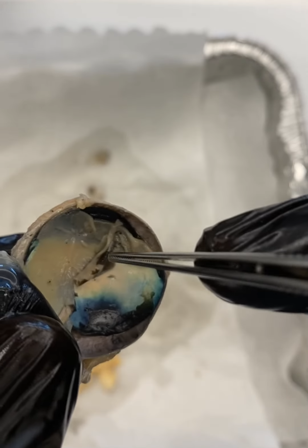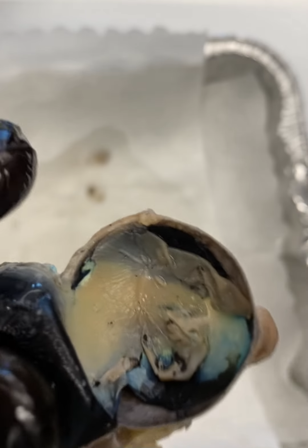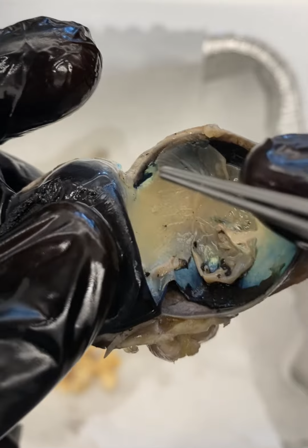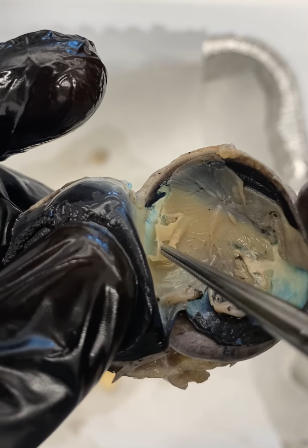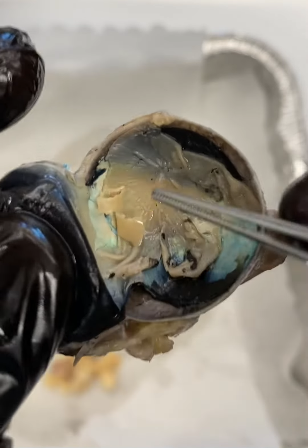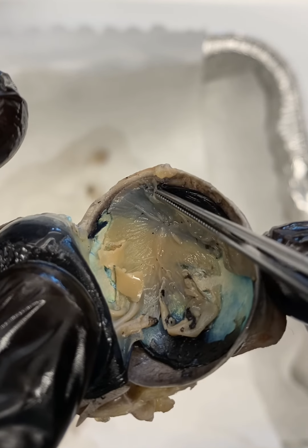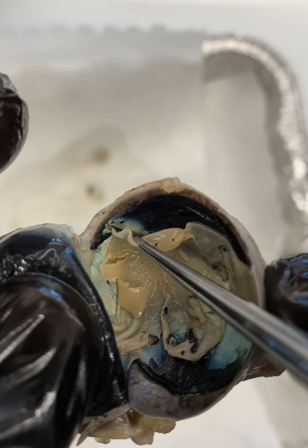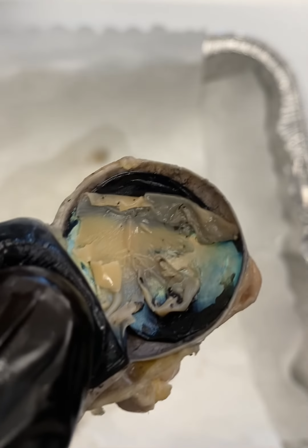If we try to flatten it back out, you can see how that was stretched out. But you can very easily take a finger, the end of a probe, the end of tweezers, or the end of scissors, and just move and tear the retina. If you've ever heard of something called a detached retina, this is what happens. A portion of the retina becomes detached from the underlying choroid. You see how you can just peel that off very easily? That's what's happening in a detached retina.